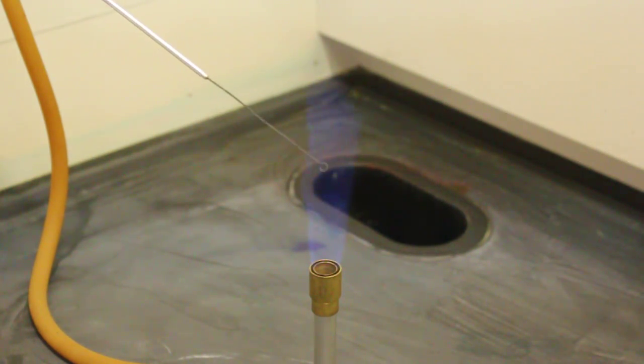This loop is now sterilized and it may be used to transfer bacteria from one location to another.